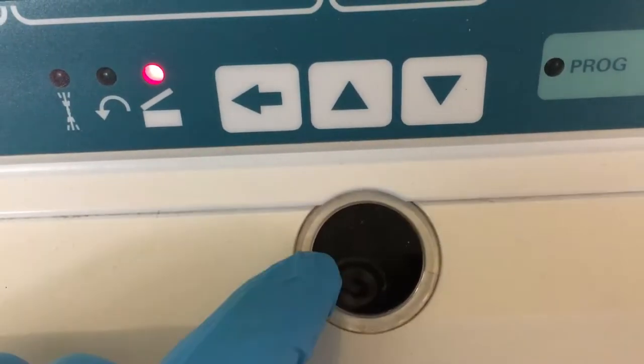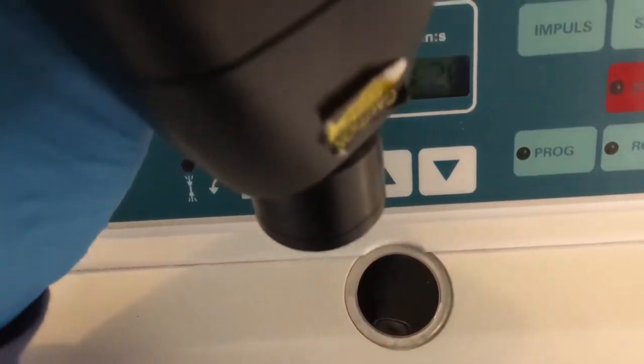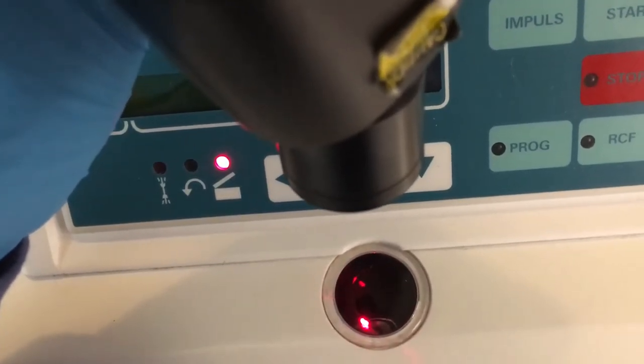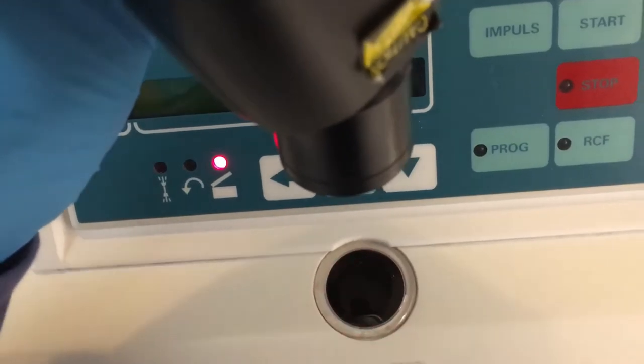If you see this window, we need to take a tachometer and we need to put a laser direct on the reflective tape.